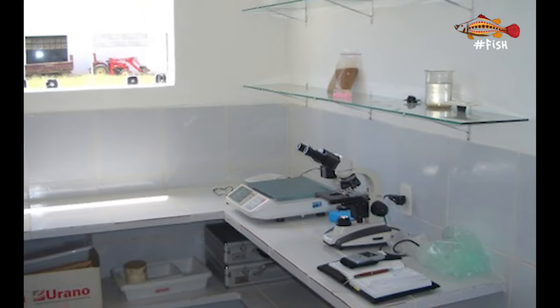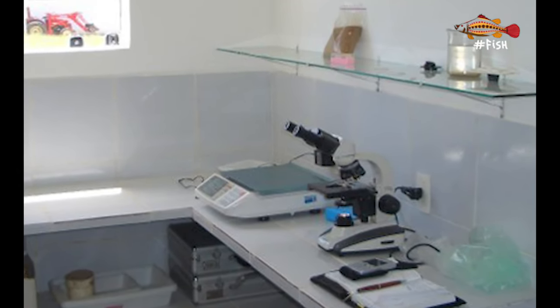How is it possible to check the health of a tiny shrimp at the post-larval stage? Well, there are several simple but very effective techniques for estimating the baseline health of PLs. For some of the tests you'll need a dissecting microscope.